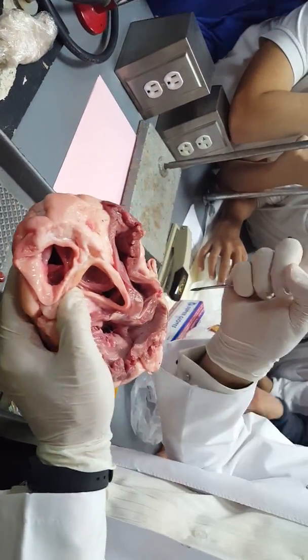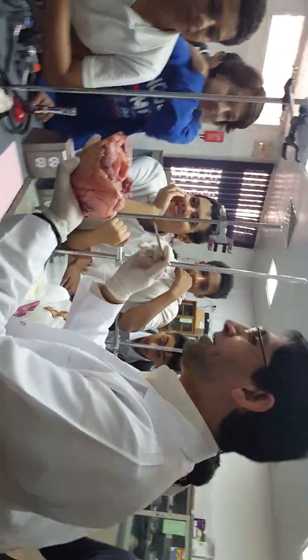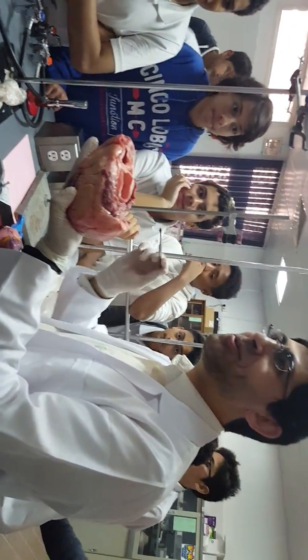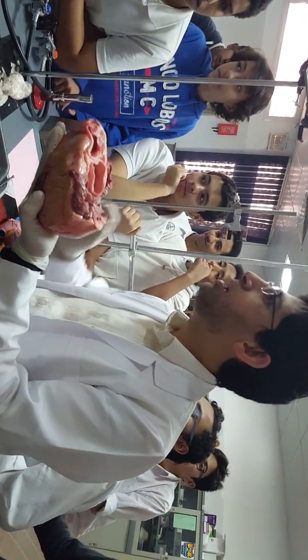One valve open and one valve close. Okay, tell me. I'm being here. Okay, one valve open and one valve close. Yes. What is the valve that will close and what is the valve that will open? Who can tell me? Atrial systole? Keep on forgetting the name.